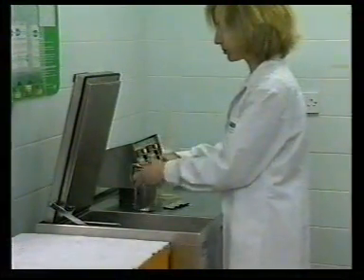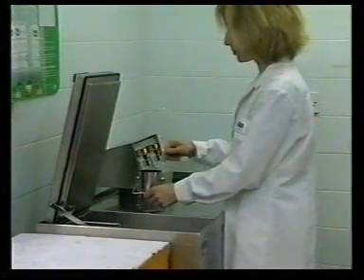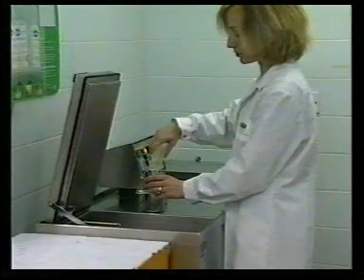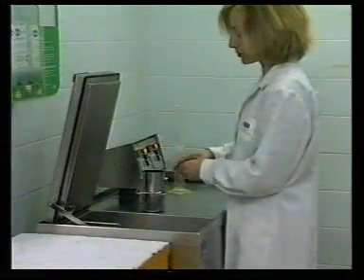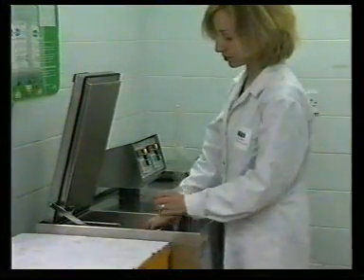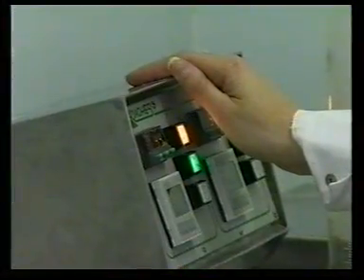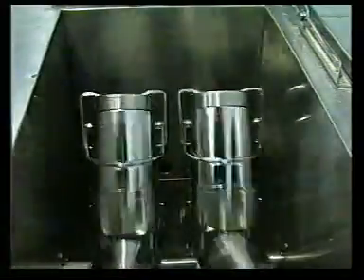The pots are removed from the wash wheel, test specimens placed in each pot, and the appropriate amount of detergent solution poured into each pot before the pot is replaced into the machine. The lid is closed, the correct temperature is checked, the time of the test run checked, and the machine is switched on.